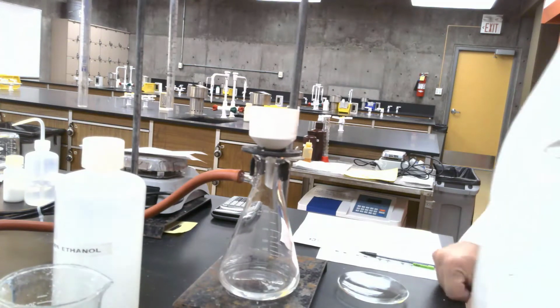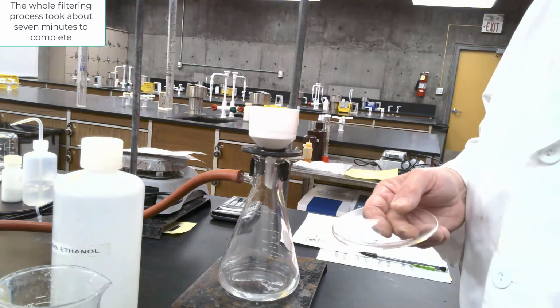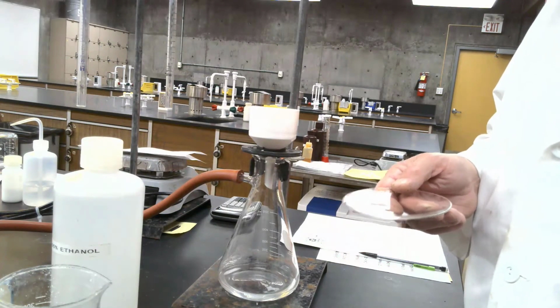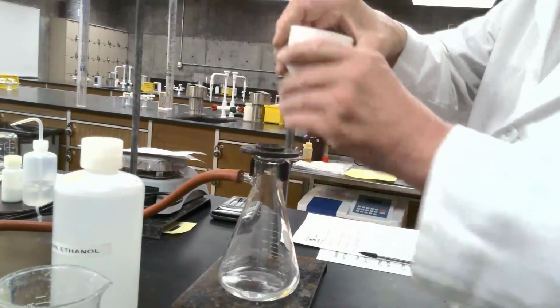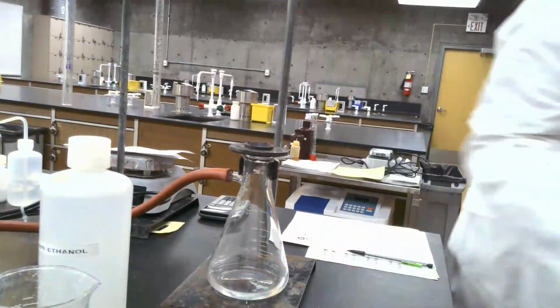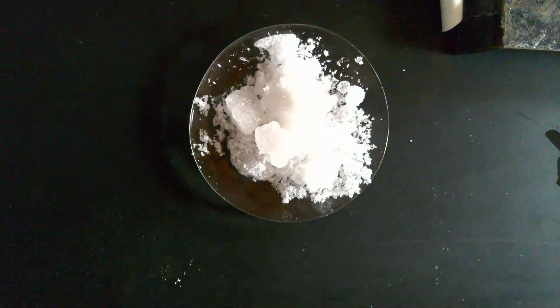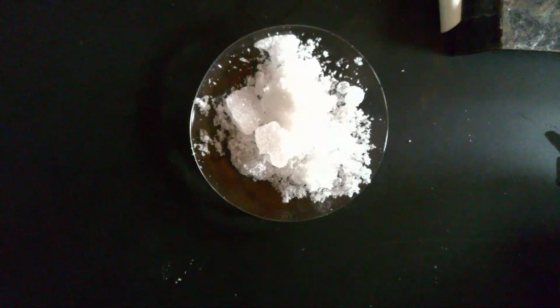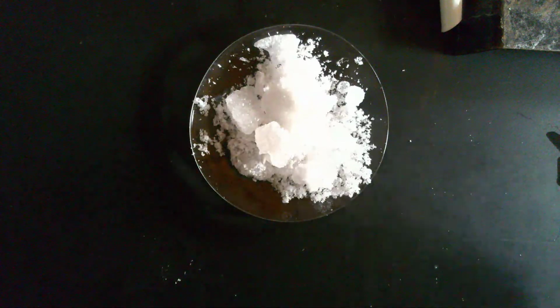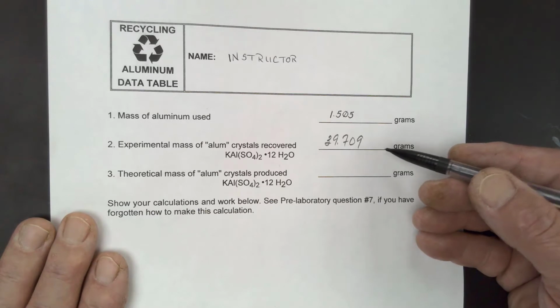Okay, I believe my crystals are dry enough to weigh, so I'm going to take a watch glass, auto zero it, put my crystals on there, and then just weigh my crystals. So what I did is I took my crystals out of the Buchner funnel, put them on my watch glass and weighed them, and I had 39.709 grams of crystals. So that's my experimental yield. I'm not sure if they're absolutely dry or not, but we'll go through with the calculations so you can follow along. So that's how many grams of potassium aluminum sulfate dodecahydrate obtained from my experiment.